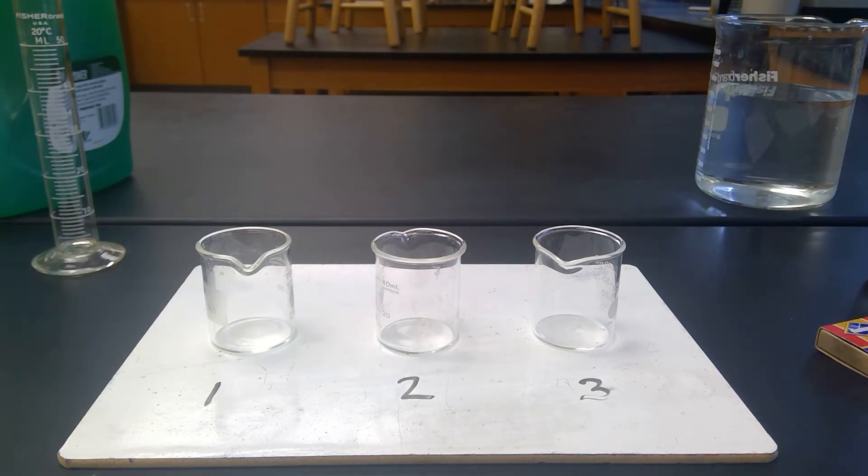Here is station two, and what I have set up are three beakers on a whiteboard that I've labeled one, two, and three.